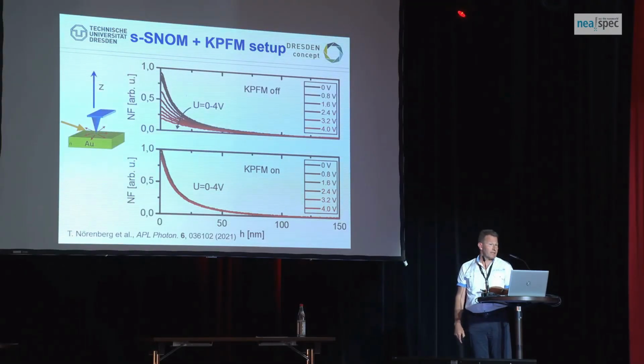So what we need to do is crank this up, so to say, to the top by switching on the KPFM regulator. And that's exactly what we do. You see nicely that all these curves now fit together, independent of what voltage we apply.